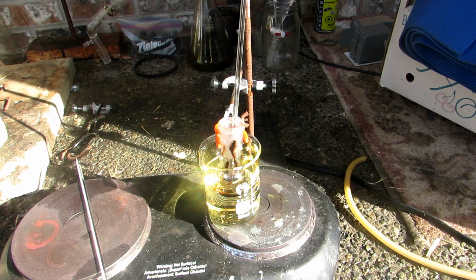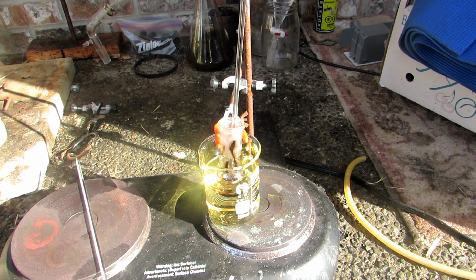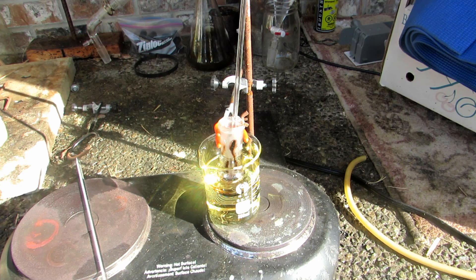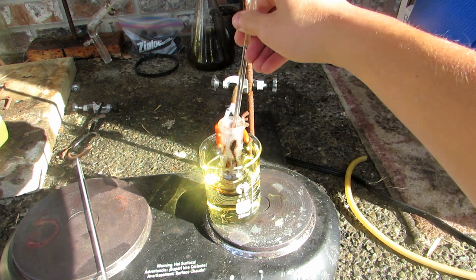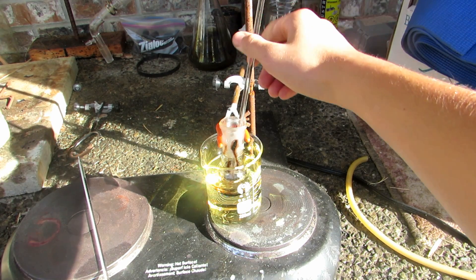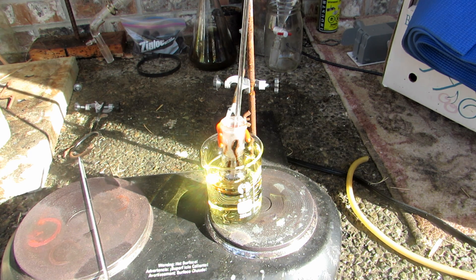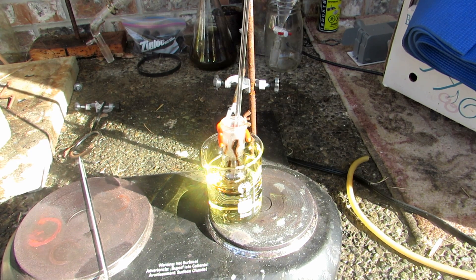I heated it for about two and a half hours and the red color has turned very very dark blood red. I stopped heating when it started to increase in viscosity and it looked like no more water was coming off. Now as you can see with the stir rod it's really black, so hopefully the reaction is done. We'll let it fully cool down and then we'll have to extract the phenolphthalein from leftover phenol and unreacted phthalic anhydride.